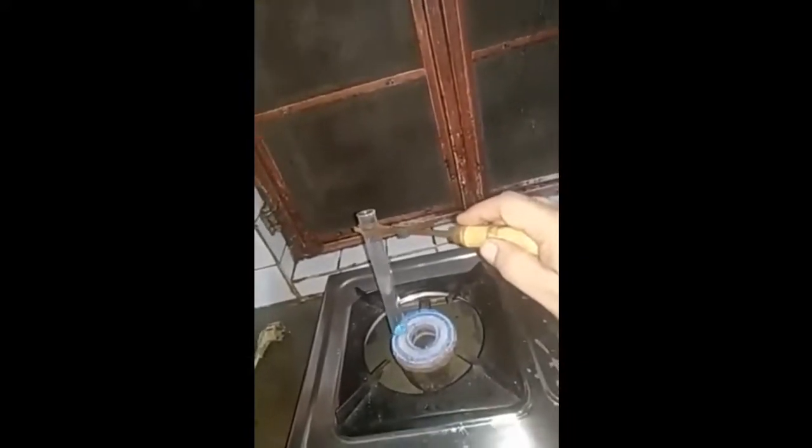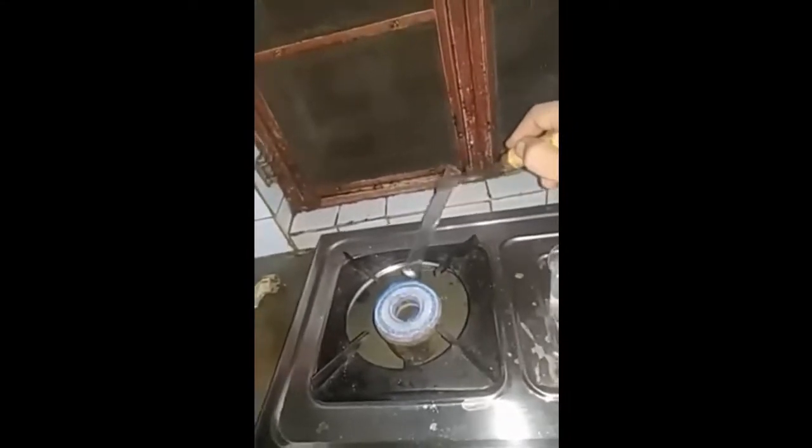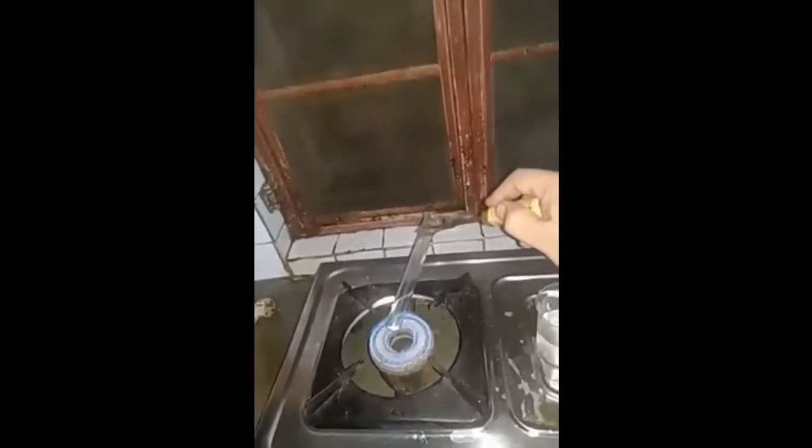You can see the salt is being heated slowly in the test tube. Now you might have observed the white colour at the bottom of the test tube. The blue colour slowly vanishes and the salt turns white in colour. Now you can see easily that the salt is completely white at the bottom. That blue colour salt has simply turned out to be white in colour.